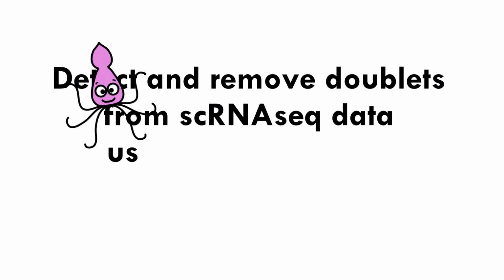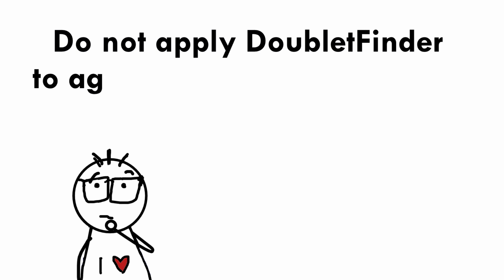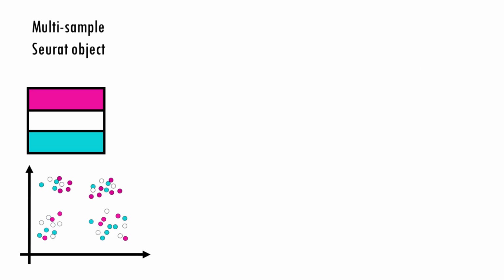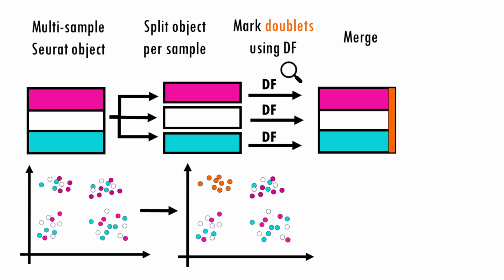So let's pick up where we left off. DoubletFinder is an R package that predicts doublets in single-cell RNA sequencing data, and one of the biggest advantages is that it is now compatible with Seurat. One important thing to note is that you need to run it on a per-sample basis, same as scDblFinder. So the way I have it set up is that I split the Seurat object based on the sample ID and then run DoubletFinder on each of the samples.